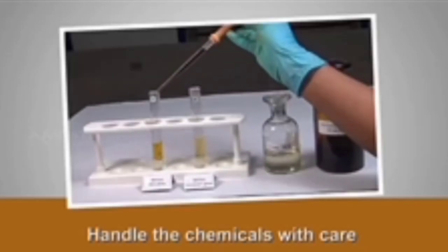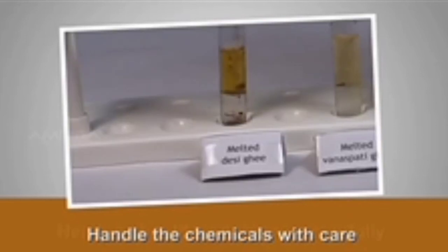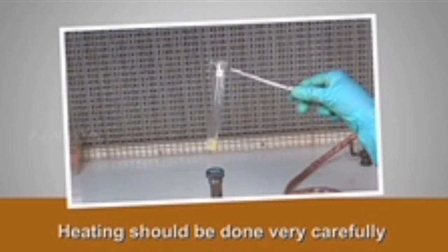Precautions. Handle the chemicals with care. Heating should be done very carefully.